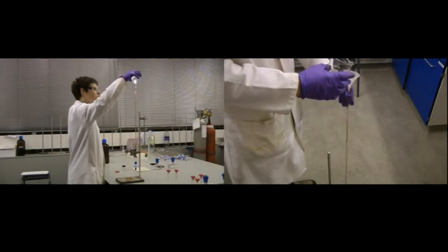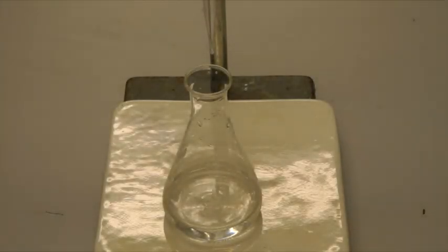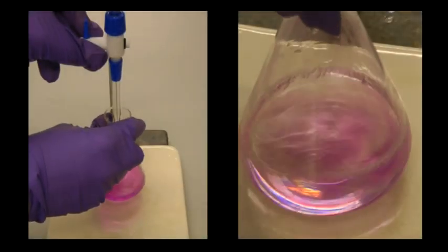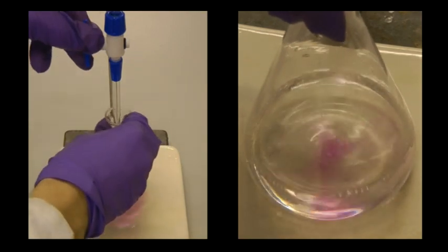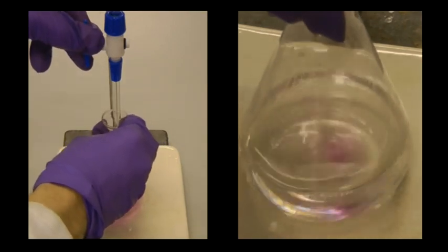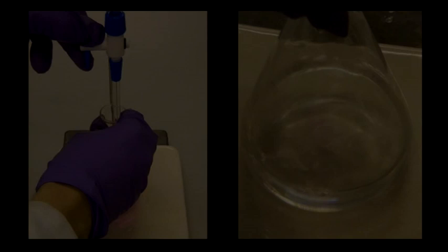Note that you may need to refill the burette before carrying out subsequent titrations, and it's wise to use a clean conical flask each time. Your teacher will give you clear instructions as to what is expected of you in terms of the number of titrations that have to be performed. There are many different types of titration that can be carried out, so it's important to make sure you listen carefully as it's easy to make mistakes.